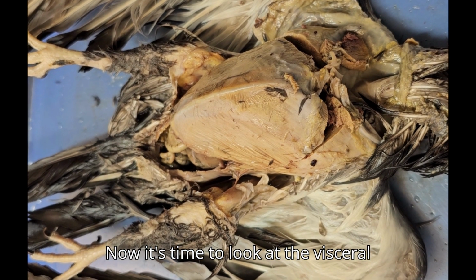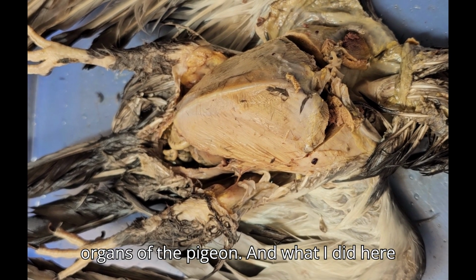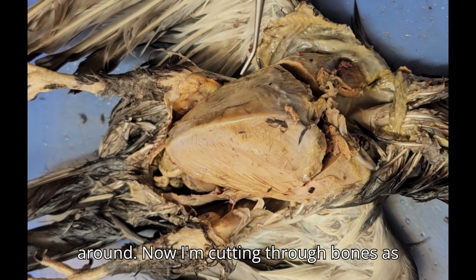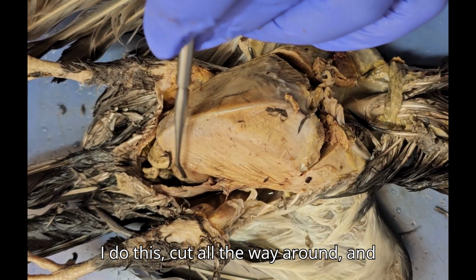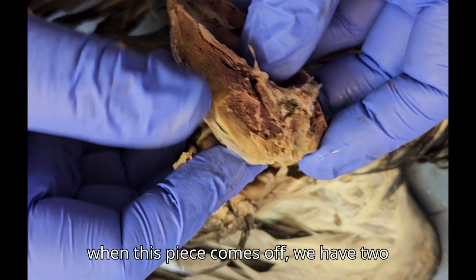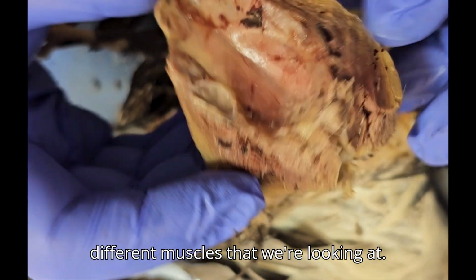Now it's time to look at the visceral organs of the pigeon. What I did here is I took a scalpel and I cut all the way around. Now I'm cutting through bones as I do this, cut all the way around, and then this piece can come off. When this piece comes off, we have two different muscles that we're looking at.